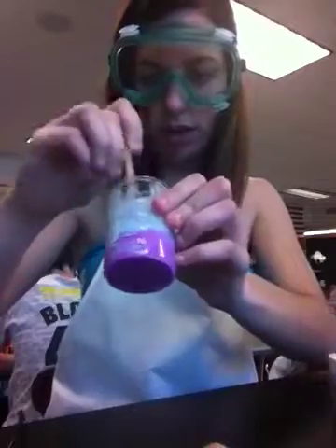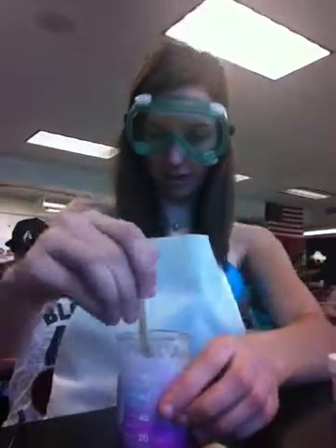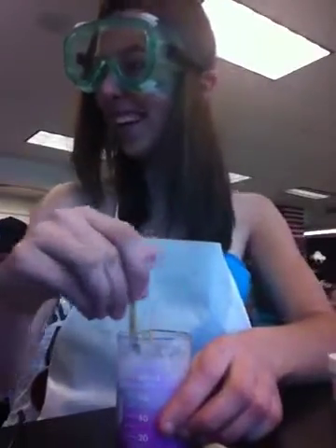It's turning a different color now. Oh, jeez. What is this? I'm gonna like burn my... Oh my god! Look at it now! It's turning purple.